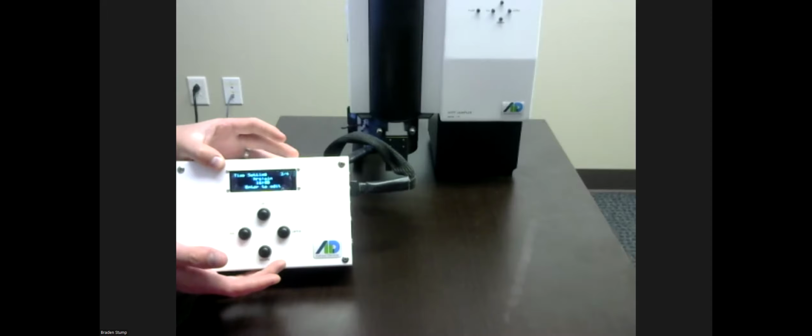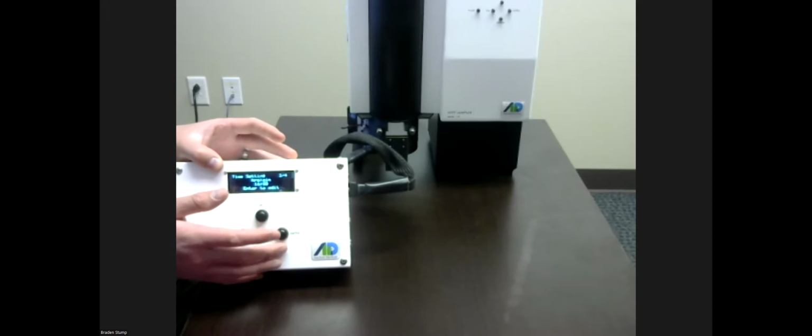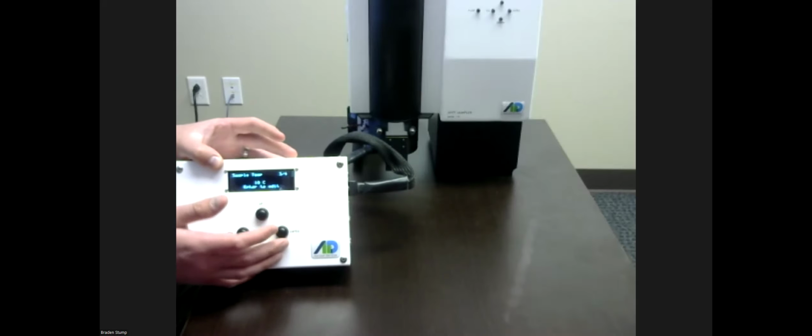This is elapsed time. So every 5 minutes when the pump stops, this is not counting down. We're only counting a sample down when the pump is operational. So elapsed time on a 16-hour sample could actually be something more like 16.5 hours, but you're only counting when the pump is sampling, when this is counting down.